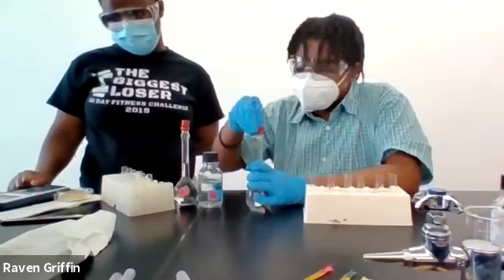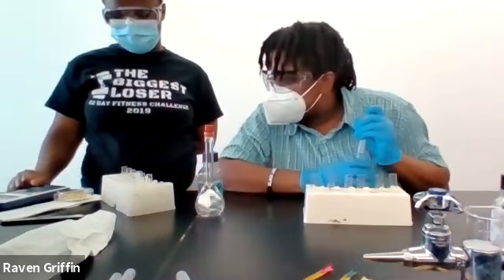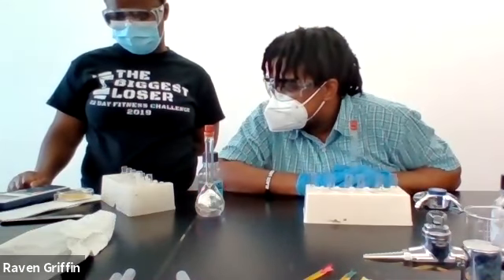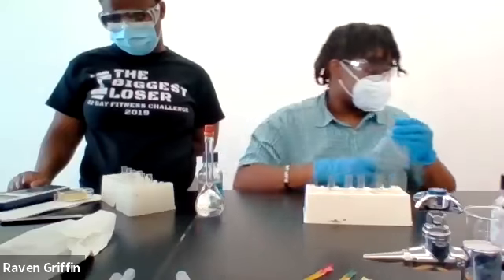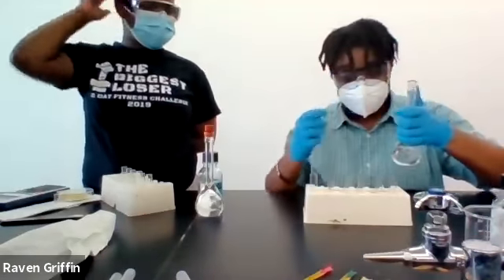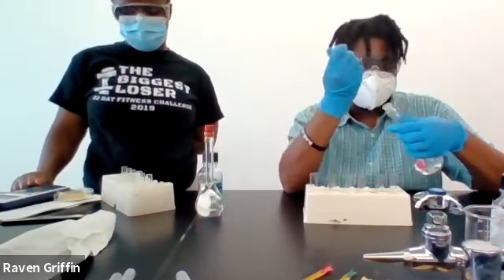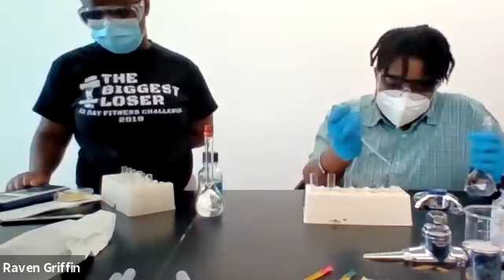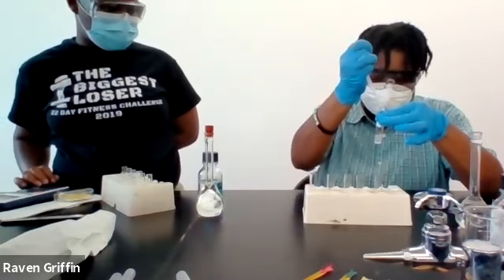So phosphoric acid first. So phosphoric acid, magnesium.